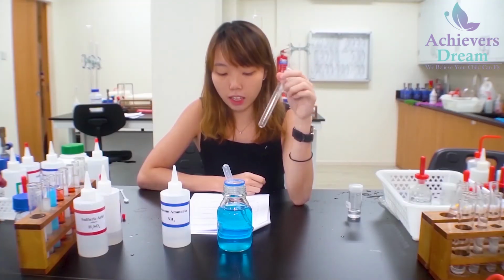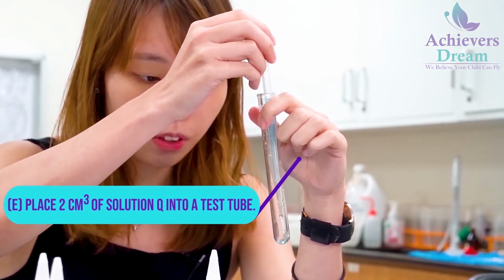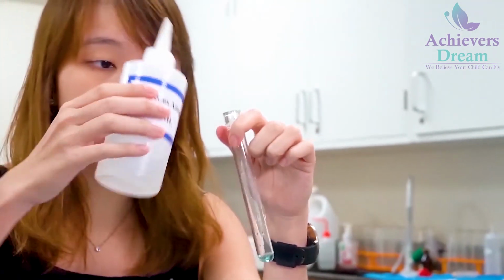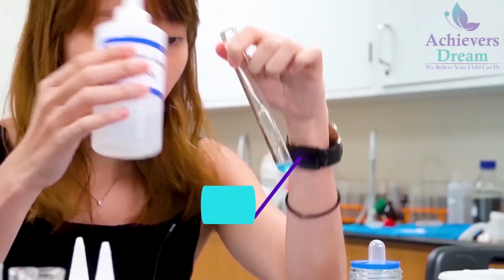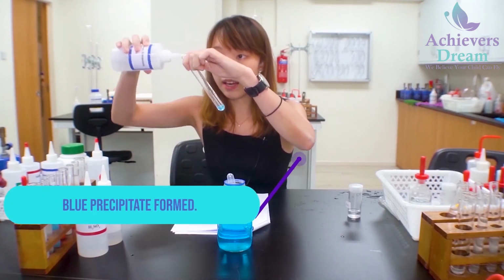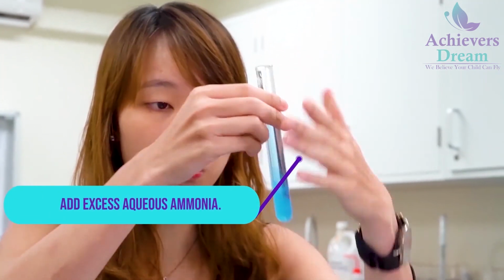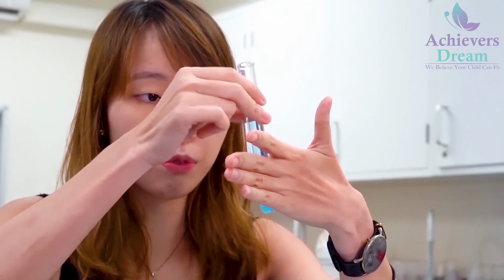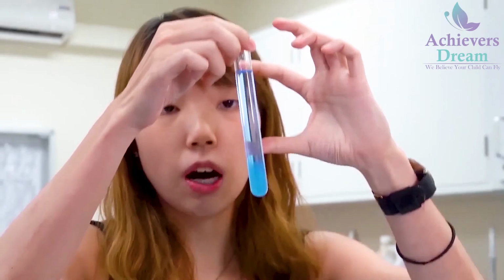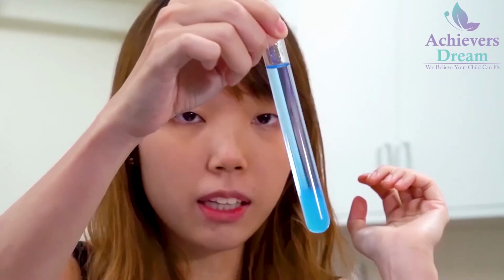Okay, so for part E, I'll be placing 2 cm cube of solution Q into a clean test tube. Okay, then after that, I'll be adding in dilute aqueous ammonia slowly. So first a few drops. Upon addition of a few drops, you notice that there's blue precipitate. Okay, so now I'll be adding in excess. Okay, so you see that your blue precipitate dissolves to form a dark blue solution. Okay, focus on the top part because that's where your ammonia is concentrated. Okay, so this is your observations for part E.